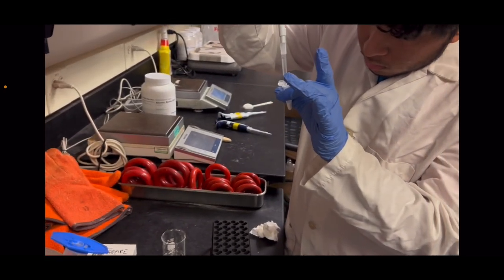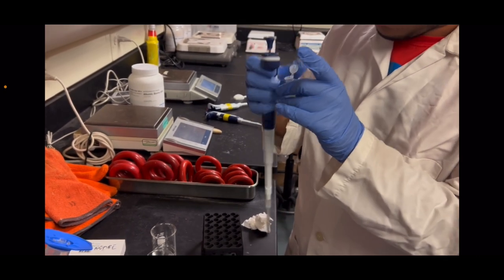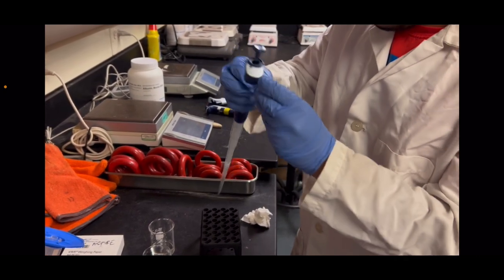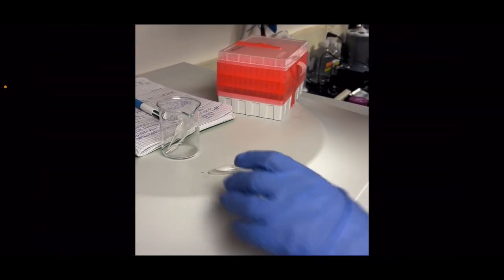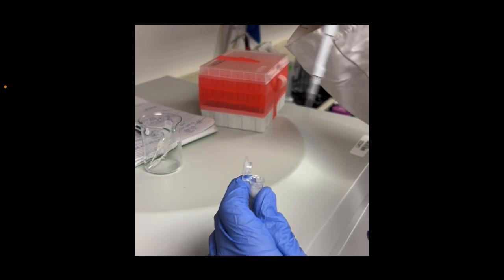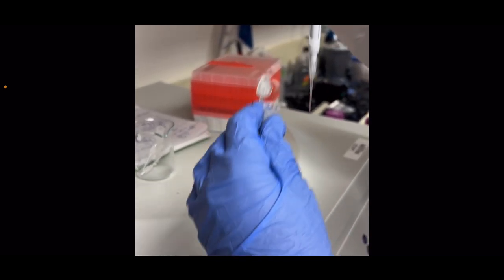Then I'll zero a nanodrop using 2 microliters of DI water, on the setting of OD 280. Now I'm adding 2 microliters of the BSA stock that I just made to the nanodrop so I can get an initial reading.